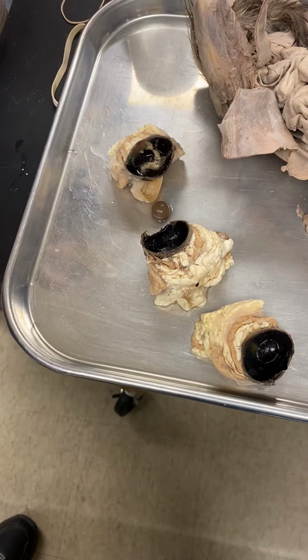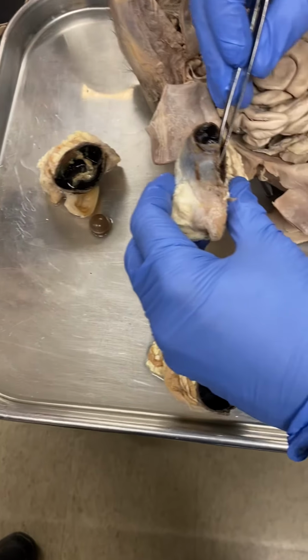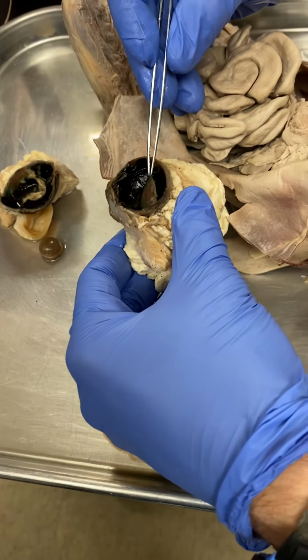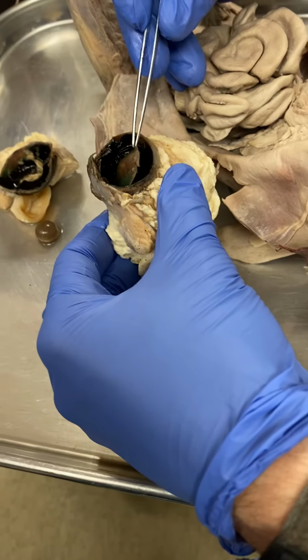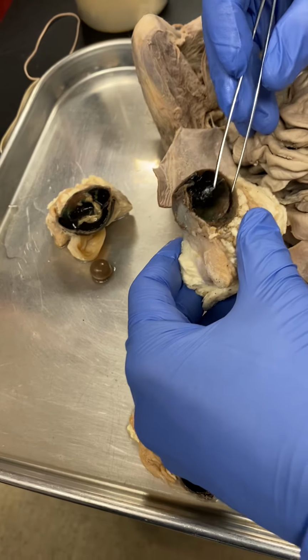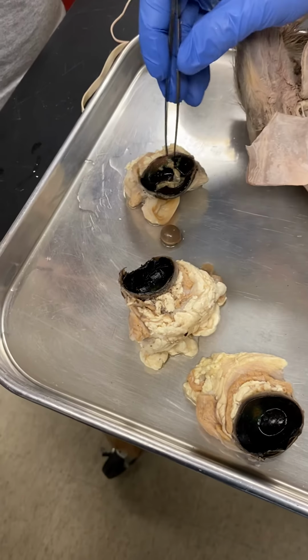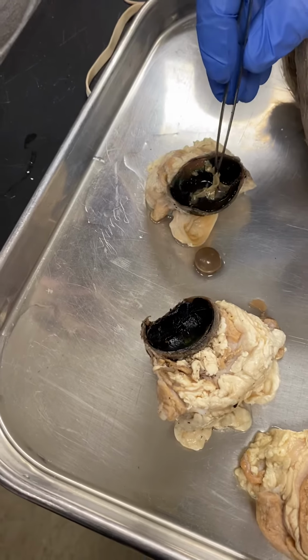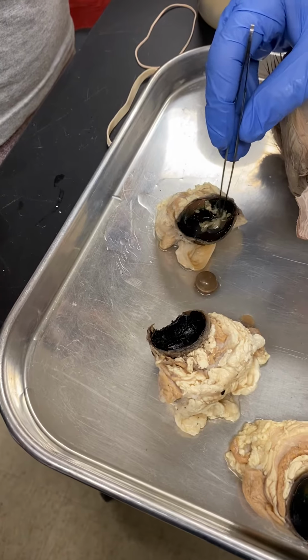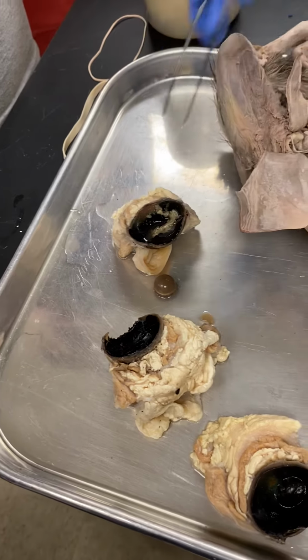All right, the other layers that you need to know are the choroid layer, and it's easiest seen as this portion here that I'm literally pulling away. Okay, so it's next to the scleral region and then the choroid region, and then you have the retinal region, or the retina here. Because this is preserved so well for so long, it's turned an opaque, pale color, and that's this stuff that is sloughed off here.